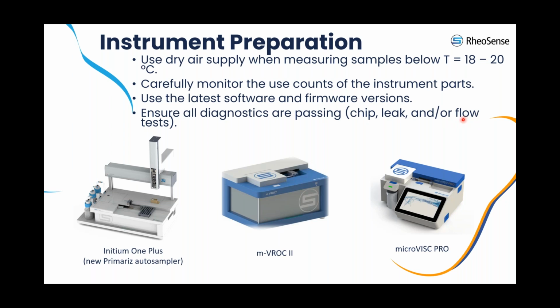If there is any clog or sample residue in the chip, the flow test will fail, alerting you that the chip may need cleaning, additional cleaning, or even in some cases, it may need replacement. Finally, the leak test identifies any potential leaks in the system. So a helpful feature of the Initium and m-VROC II software is that if the leak test fails, it provides step-by-step troubleshooting instructions that helps you resolve the issue quickly by yourself.